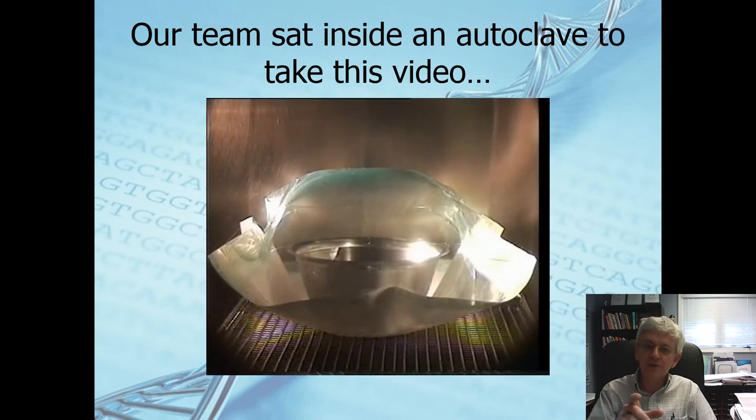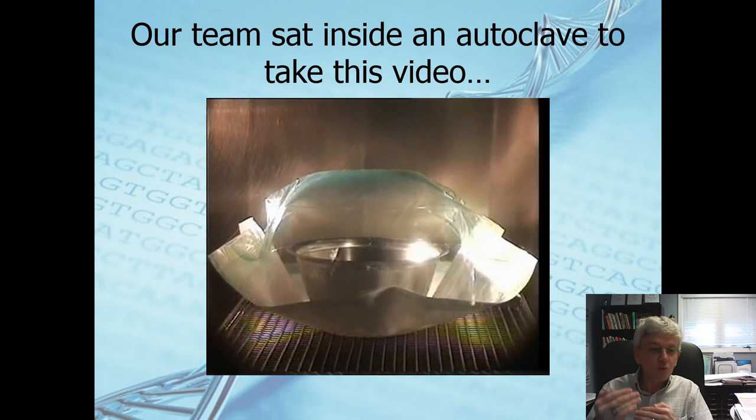It's going to go back and forth in this cycle time and again through this entire cycle. Now you have a pretty good idea why your job in loading and placing and controlling the autoclave prep is really critical for the success.